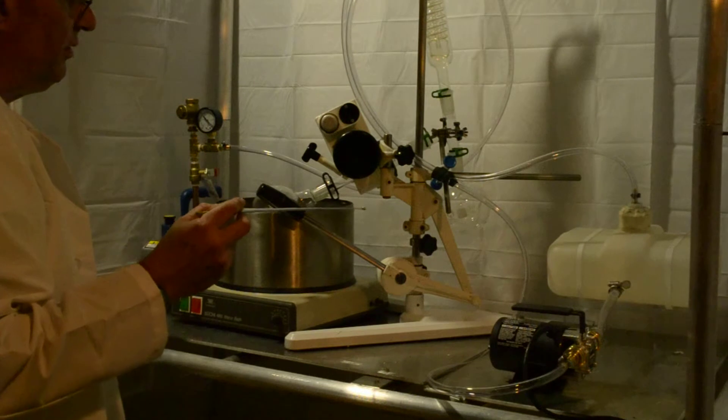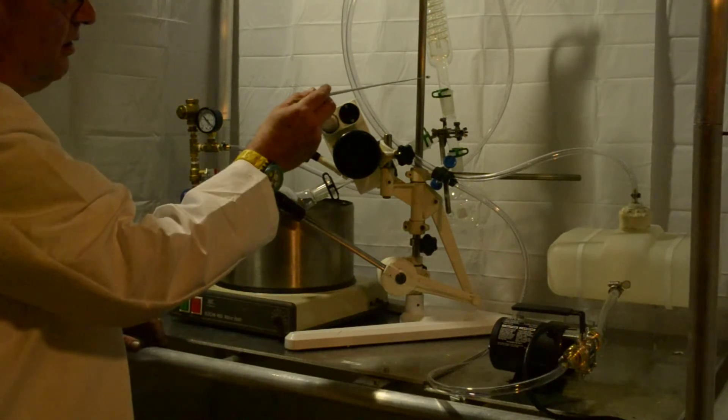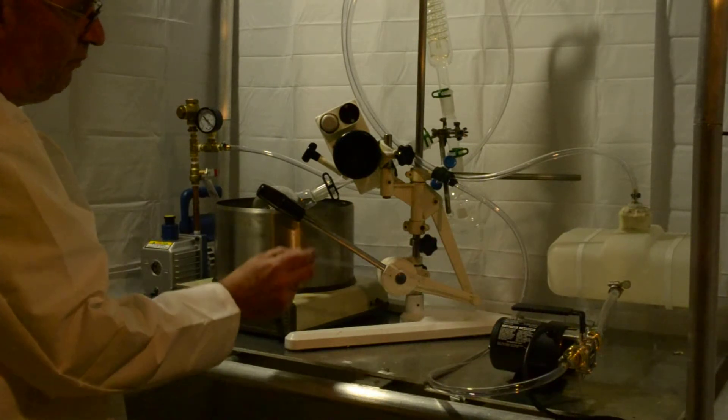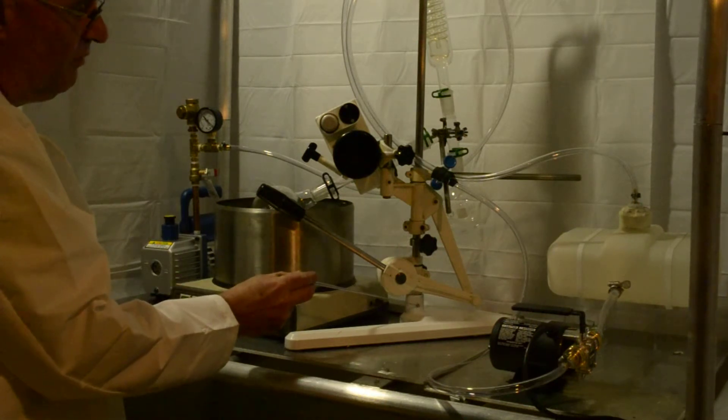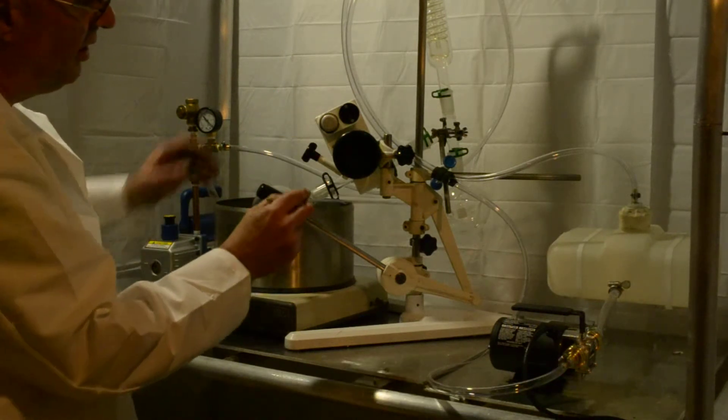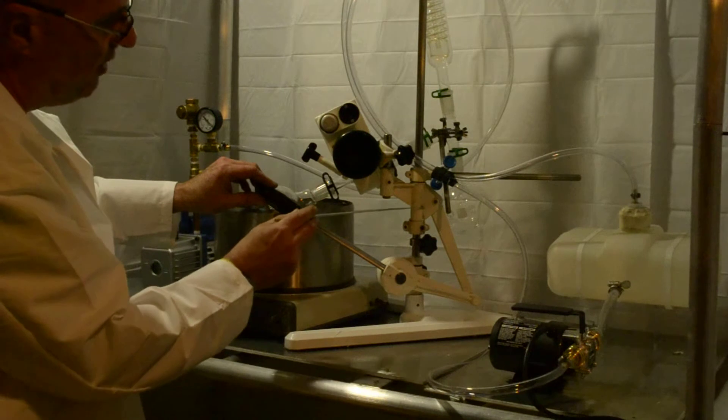Your assembly is pretty much like this. This bar here is going to be not connected to here initially. Allen fittings, insert your bar first into the base, tighten everything up, slip the handle mechanism all on. This will slip on first and then this part.